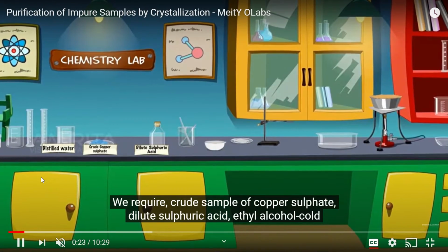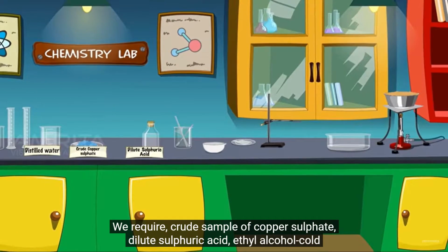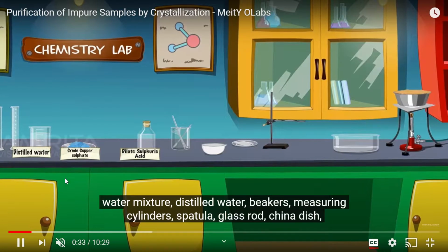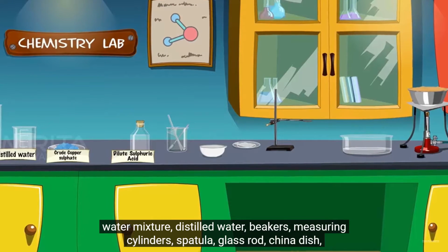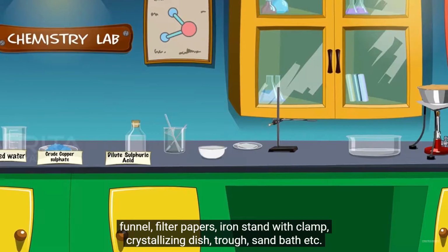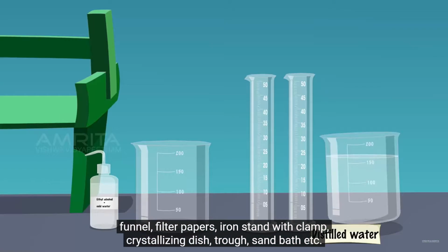We require crude sample of copper sulfate, dilute sulfuric acid, ethyl alcohol, cold water mixture, distilled water, beakers, measuring cylinders, spatula, glass rod, china dish, funnel, filter papers, iron stand with clamp, crystallizing dish, trough, sand bath, etc.